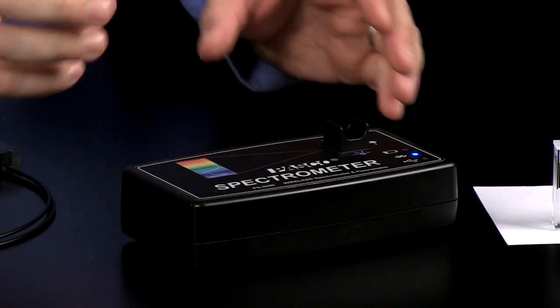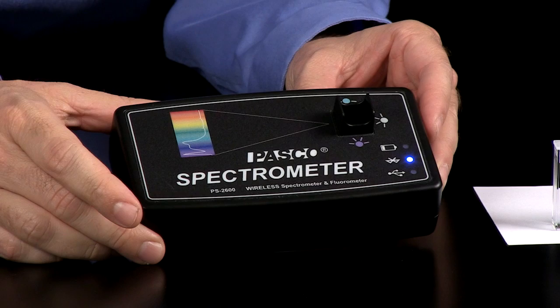Hi, this is Tom Loschiavo, Chemistry Education Manager at PASCO Scientific. I'm here today to introduce the PASCO Spectrometer.